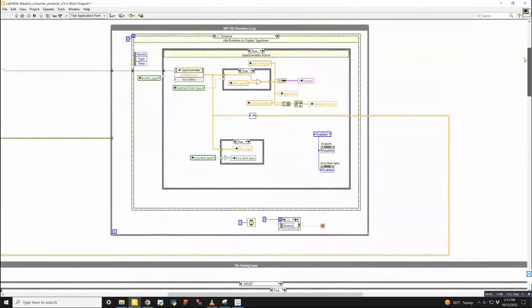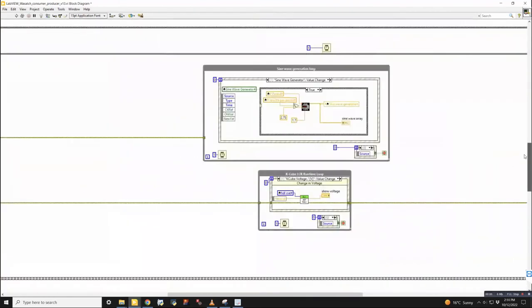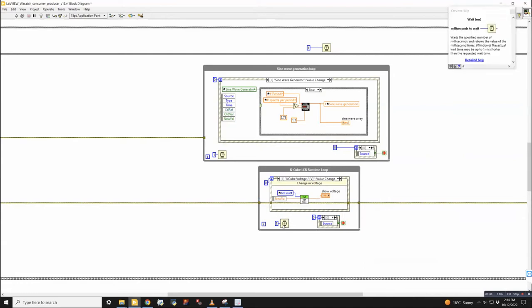So I'm going to start talking about the runtime in the most simple way possible. I think the simplest one is the K-Cube operation. Once we've reached this while loop here, essentially we're waiting for user input. These while loops will run as fast as they can unless you tell them not to. So this is a wait timer. The input is in milliseconds, and this tells it to wait 1 millisecond before it moves on to the next loop. So running at 1,000 loops per second is pretty reasonable.